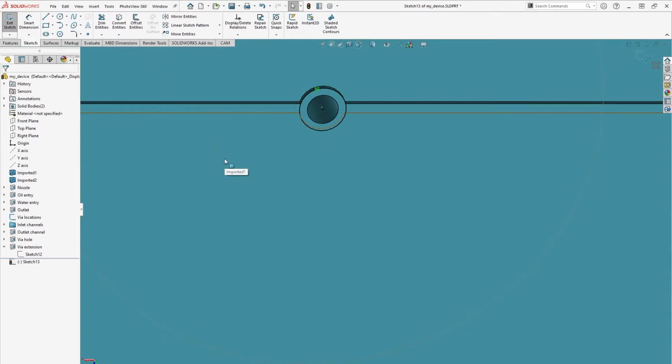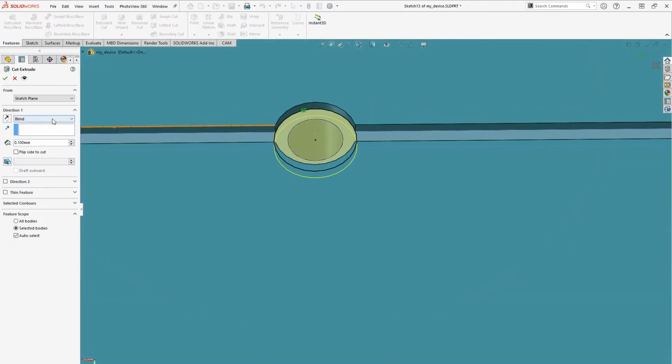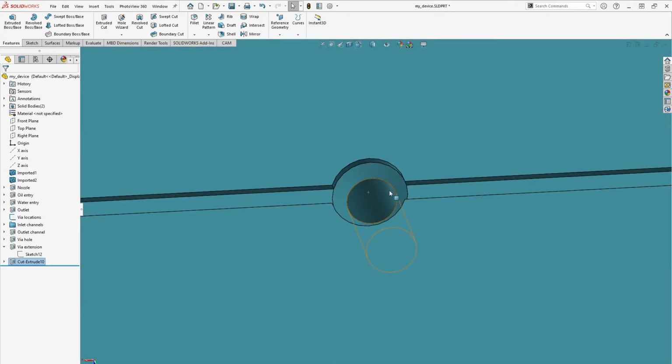We'll extrude cut this sketch through all, making sure to set the included draft to 45 degrees. Press confirm and we should have a nice smooth cone connecting the via hole to the channels. Creating this conical interface both reduces the chances of burrs and prevents them from blocking channels. We recommend this type of interface for all vias as part of our design for manufacturing feedback here at Parallel. Let's rename the feature Via Taper and put all of the via related features into a folder.